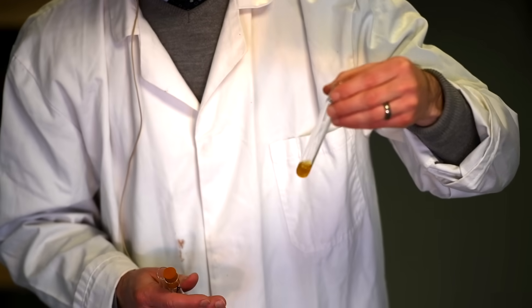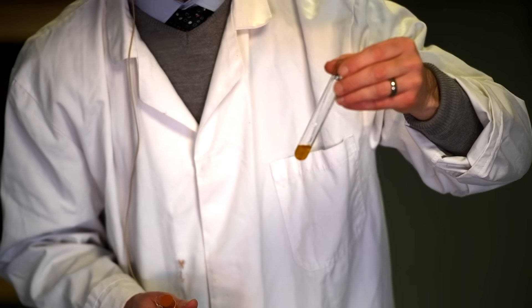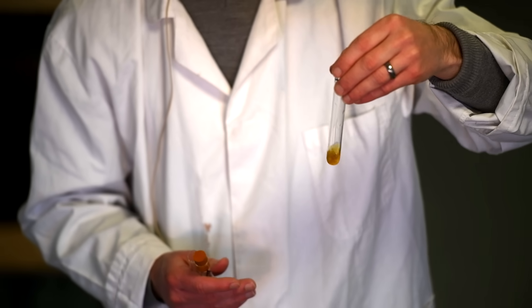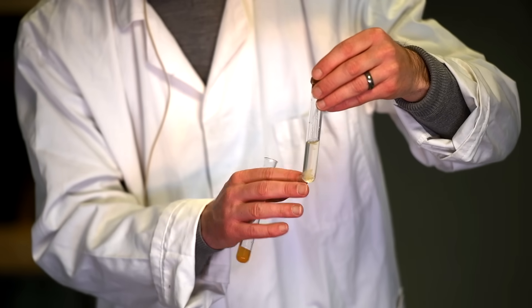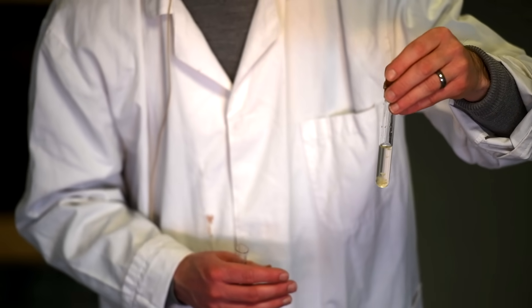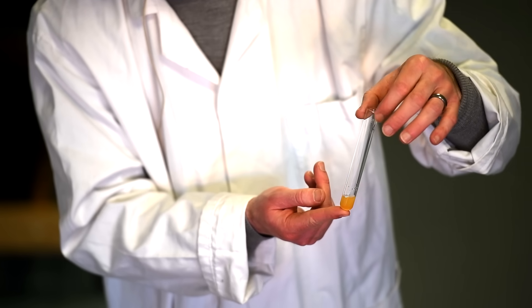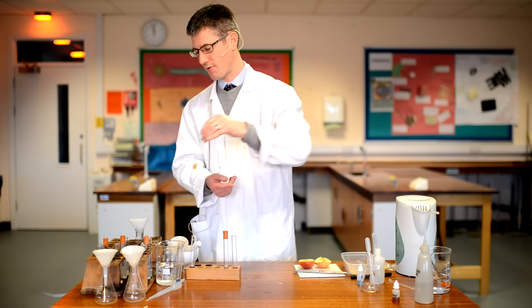We've then got the iodine test — we added some iodine to test for starch, and we've actually got no real change there, so no positive result for starch. We've got the fats or lipids test: the solution is clear and colourless still, so again there's no indication of fats — that's a negative result. And finally the protein result — there's no obvious colour change here, so again it's a negative result. So for apple we have positive for glucose and negatives for starch, lipids, and protein.